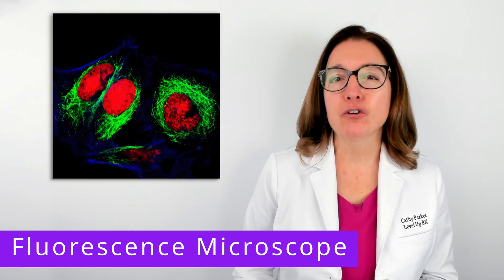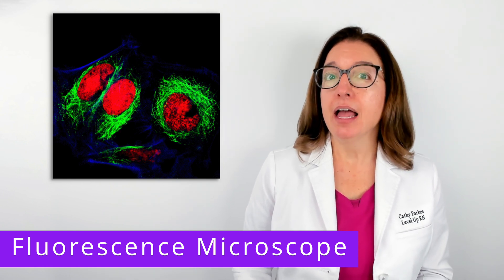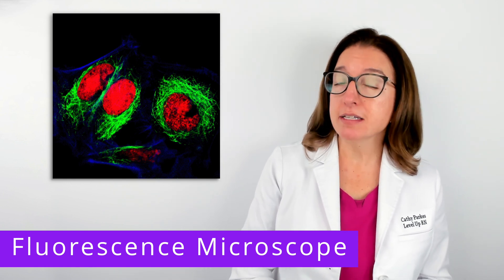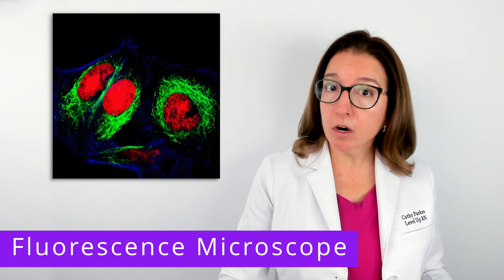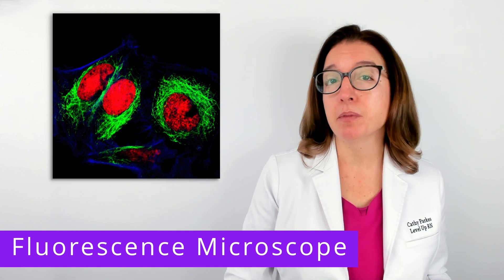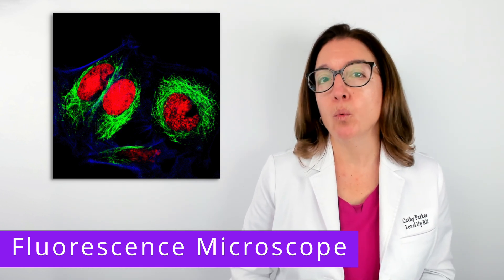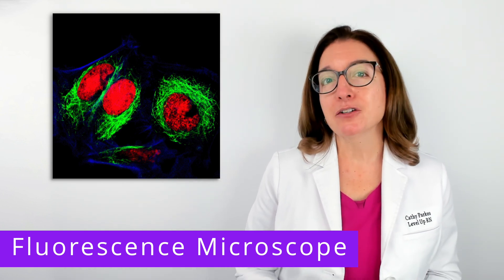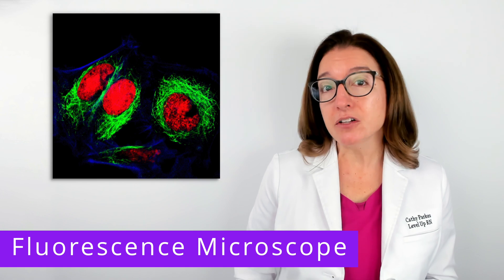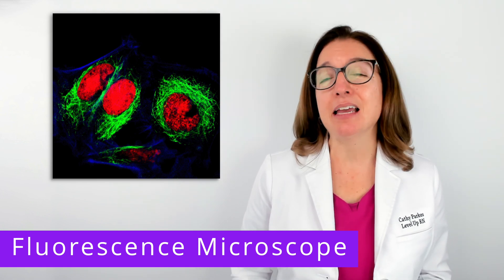Next, we have a fluorescence microscope. When using a fluorescence microscope, a fluorochrome, or fluorescent dye, is added to the specimen. These fluorochromes then absorb short-wavelength light from the microscope and emit visible light with a longer wavelength. This produces a bright image on a dark background. This type of microscope is often used in a clinical setting to identify a particular pathogen in a patient's sample.